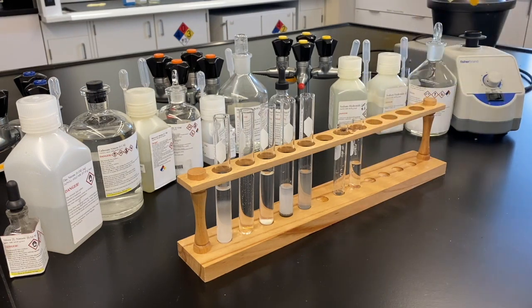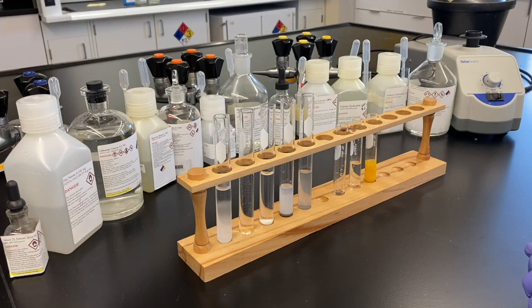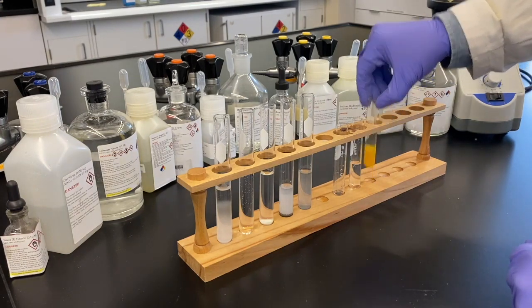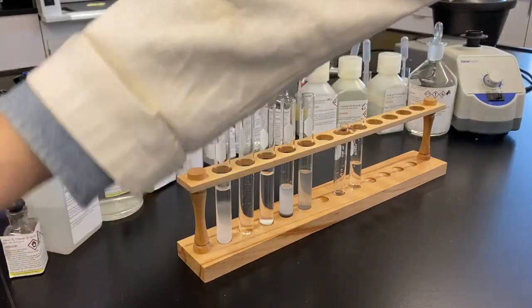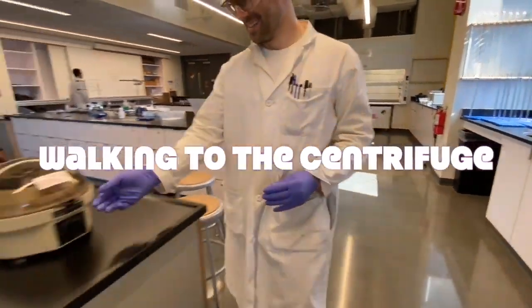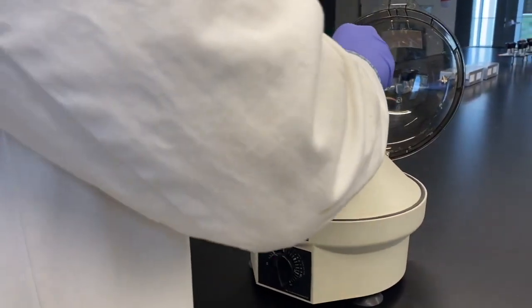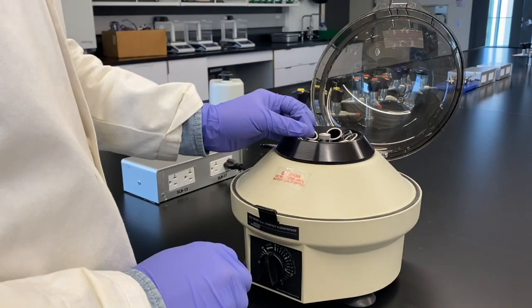So to the supernate from the first branch in the reaction, we are adding sodium hydroxide. Remember, in this side there could be zinc, there could be mercury 2, and there could be cadmium. Wait, I recognize that color. Yeah. If we were taking good observations, which of course we would have recognized that orange as being the mercury 2. So we know that's present for sure.